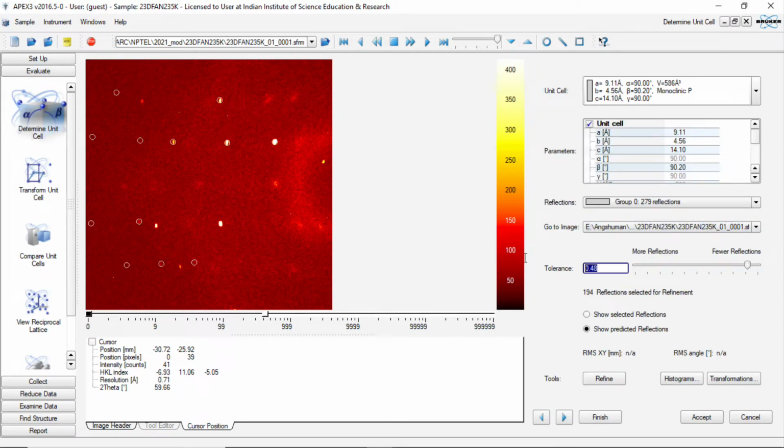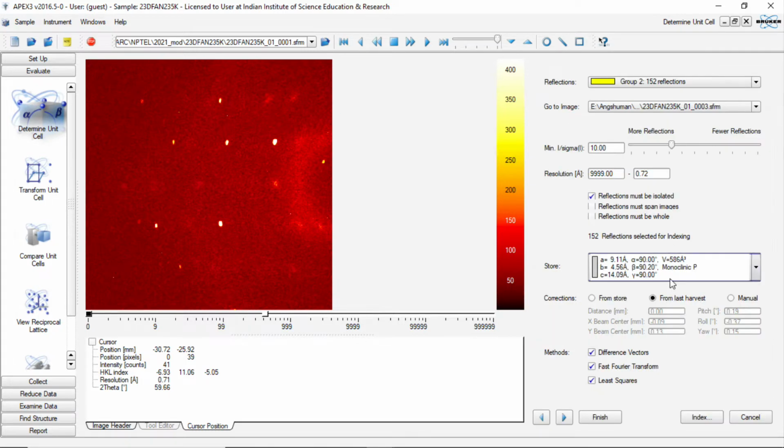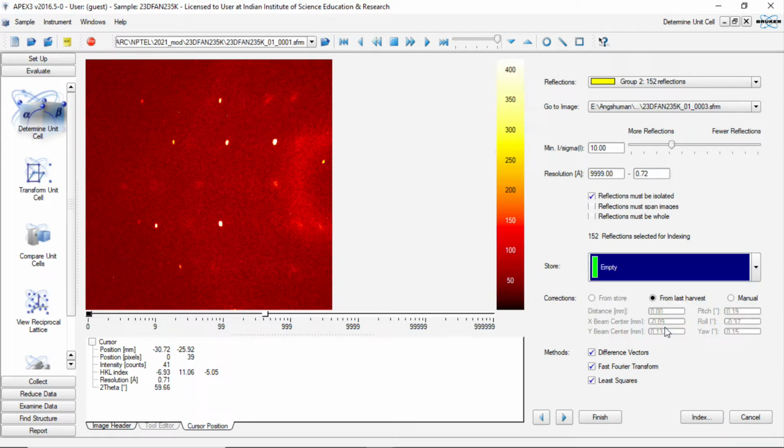So by accepting this, again we should do the unit cell refinement and do it a few times and accept it. So this is the unit cell corresponding to gray. Now I take this yellow and index it, and of course now since we are not considering green, the next indexed pattern will be in green.